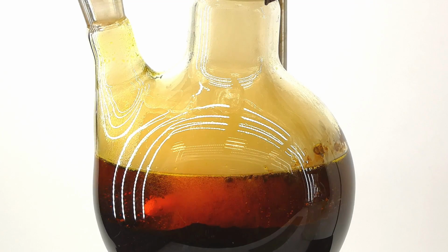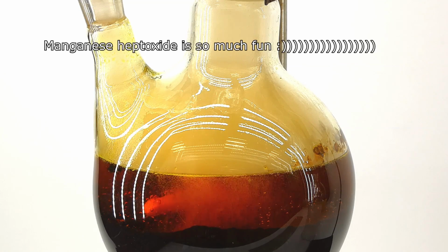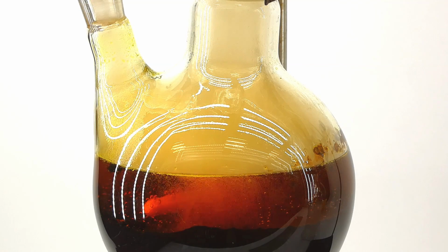The manganese heptoxide method also can't contaminate the bromine in any significant way, and involves the use of pretty basic reagents, so it will be just perfect for me. There are also some safer ones, like the one involving sodium persulfate or hydrogen peroxide, but I went with the heptoxide one, because for me it seemed the most fun and accessible one, and it is said to have a pretty high yield, which will save on the expensive potassium bromide.